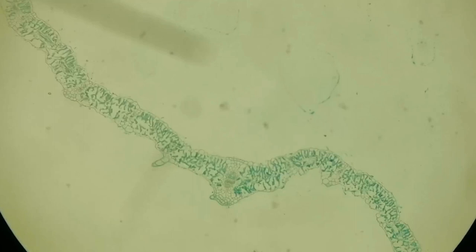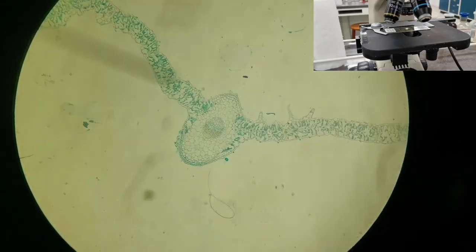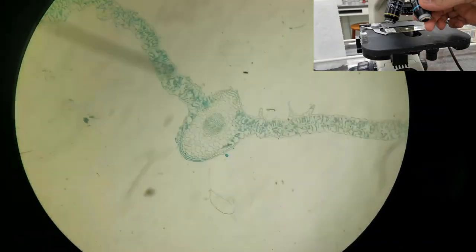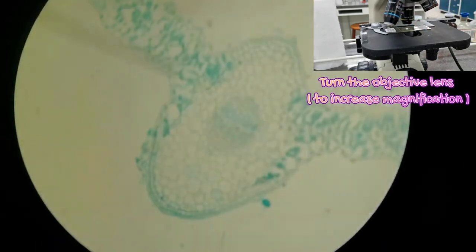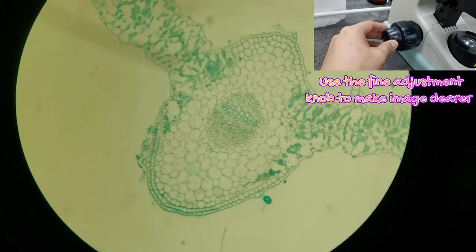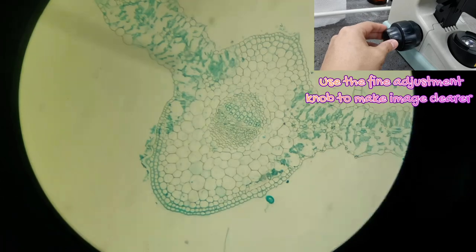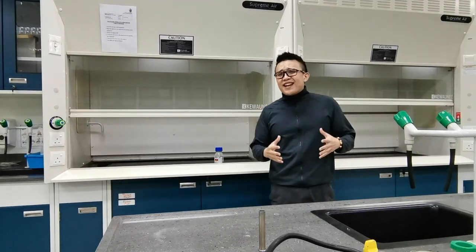You can turn the objective lens around to increase the magnification of your specimen. Turn the objective lens and use the fine adjustment knob to make the image clearer. Turn the objective lens again to increase magnification further, then use the fine adjustment knob again for a clearer image.